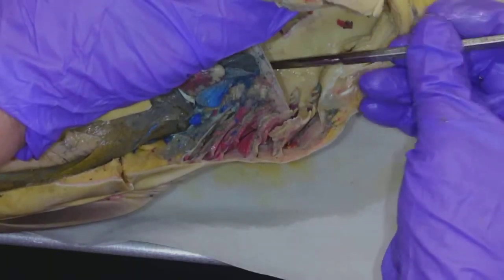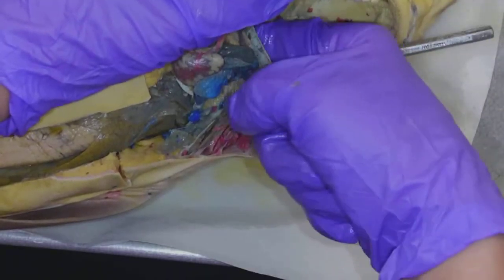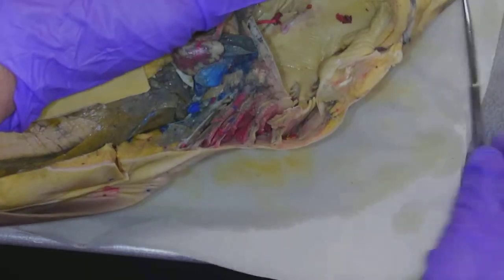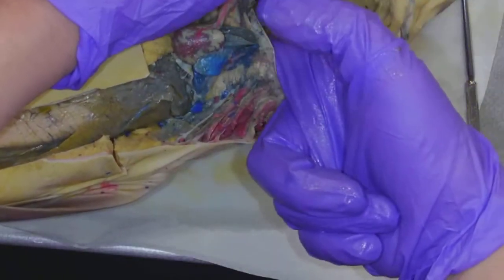The food is going to pass down, and it's going to go down his gullet. That is going to be opening to the esophagus, down that way. A little bit hard for me to show without really manipulating everything, but my finger is going down the esophagus.